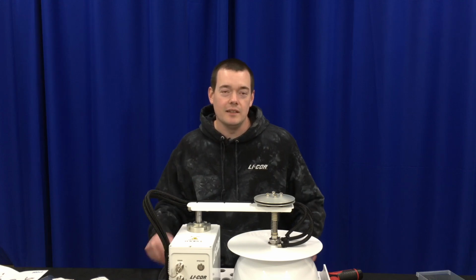Hi, I'm Nathan. I'm a technician at LI-COR, and today we'll show you how to replace the shaft seal on the 8200-104 long-term chamber.